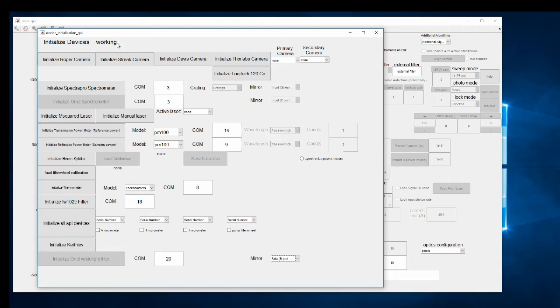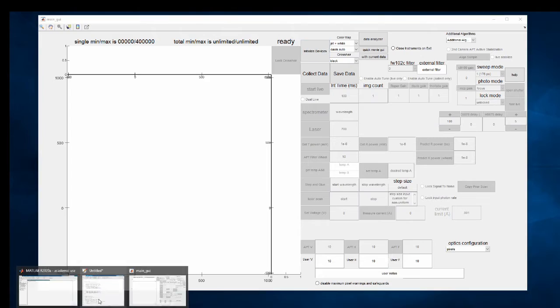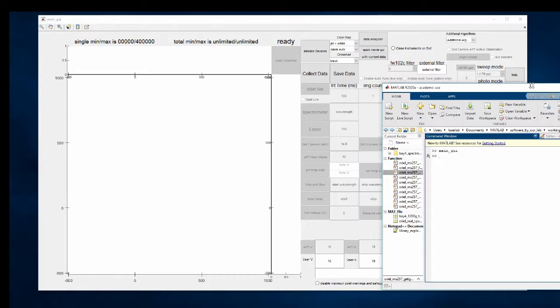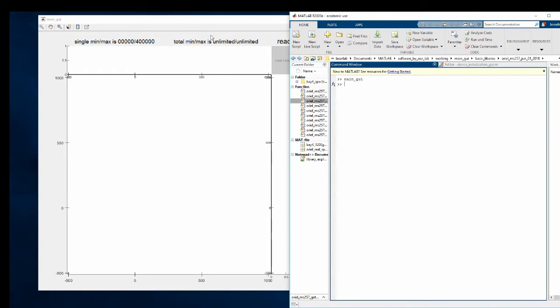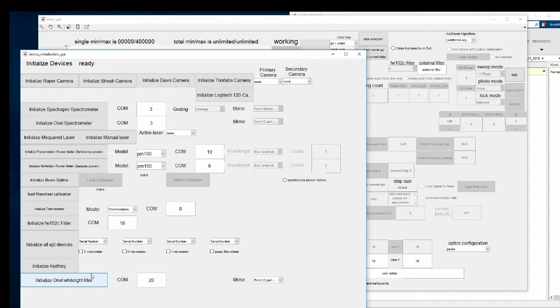This takes a little bit. Okay, and it's done. So now if I close this, I might get all sorts of errors because I haven't taken care of main GUI yet. Seems like it's okay. Now, if I go back into initialize devices, these buttons are back to what they were before. So it says C, but we're pretty sure we're on B. And this button should be grayed out.